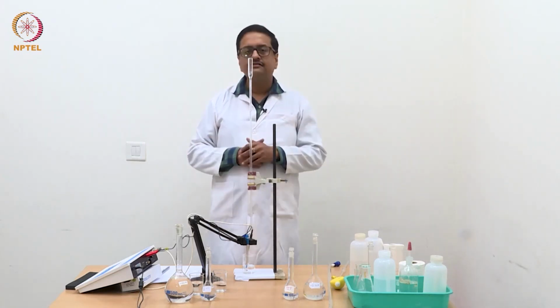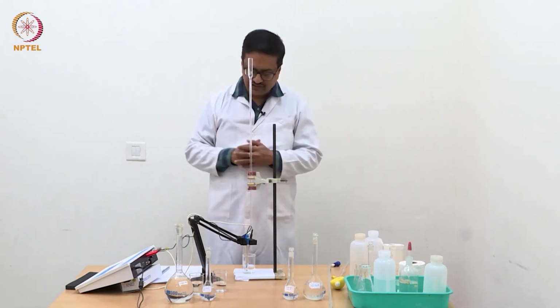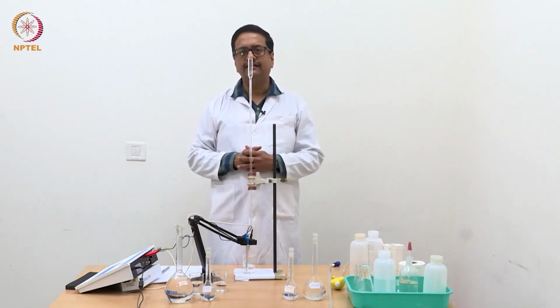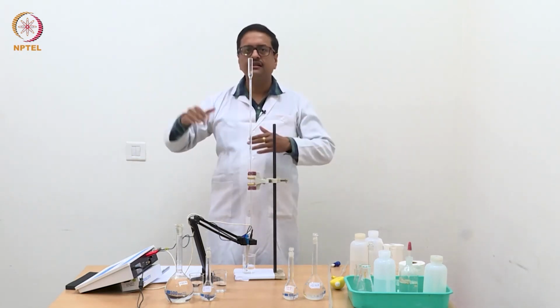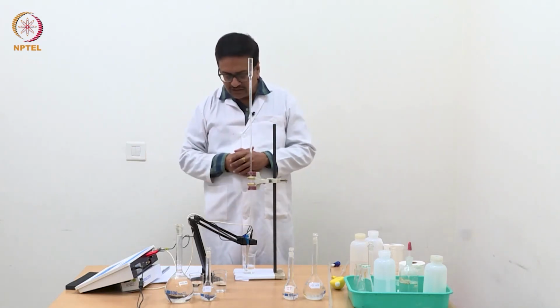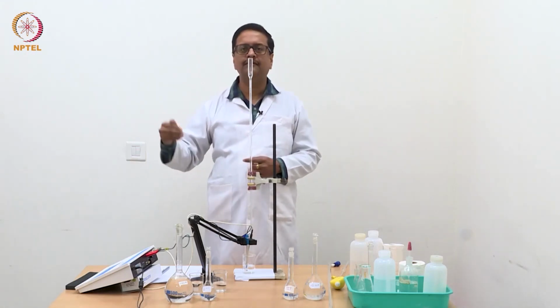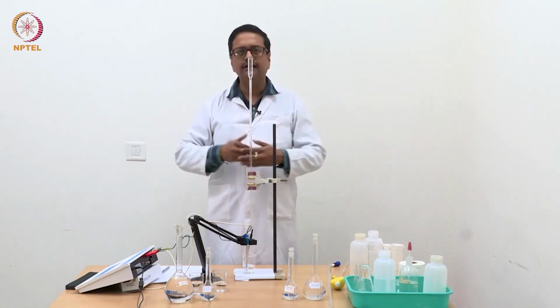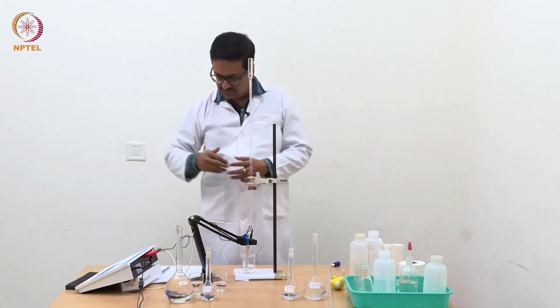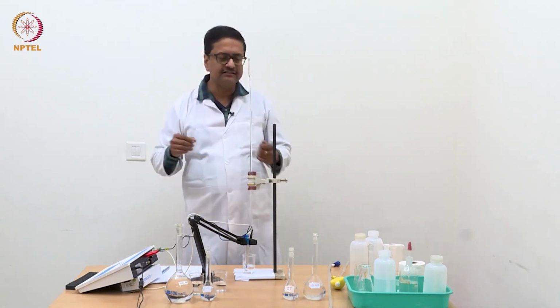So to end this titration, to be able to draw a straight line after the equivalence point is reached, we would need 3 or 4 points after equivalence, maybe 5 points. For that we will add 0.1 ml at each step and record 5 conductance values, which will be continuously increasing.